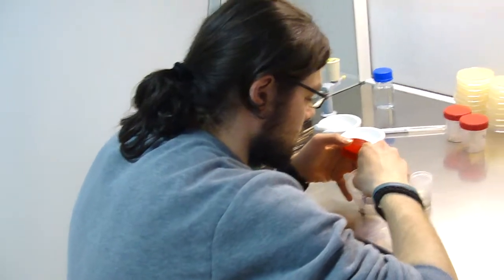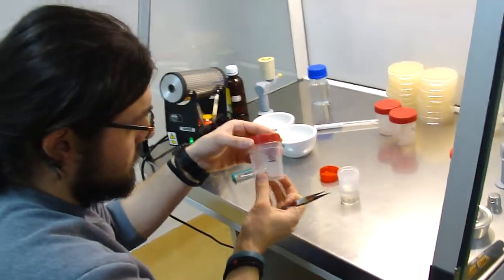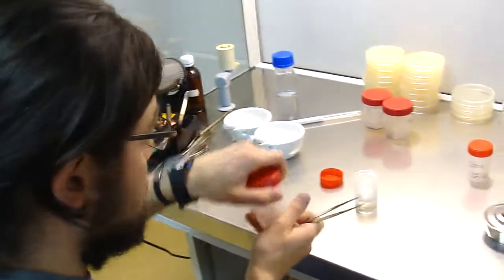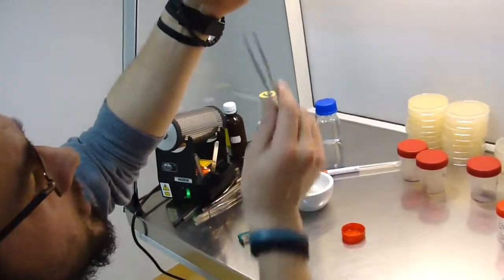I guess that's enough. Okay, according to the sample thickness you can calculate. They are almost the same in size.